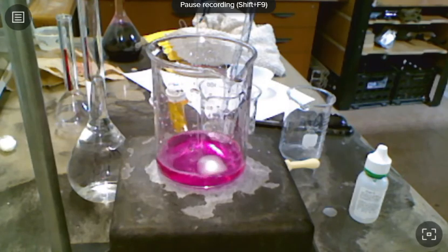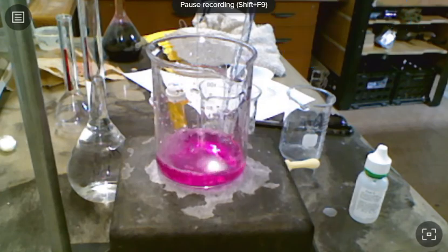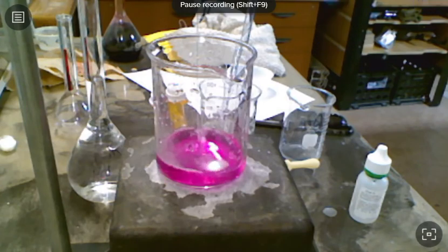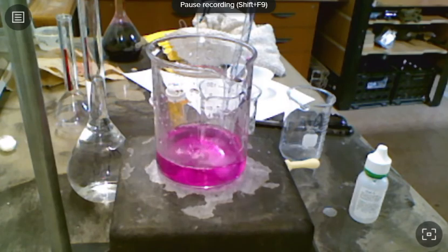A nice little stream here. And usually when people do a titration, they do one that's really rapid to start with. They don't try to dial it in. They just want to get within like 1 mil or so. And then they go back again and do the titration when they know where it's close to the end point. So I'm just letting it run freely right now, because I have no idea how many milliliters it's going to take.